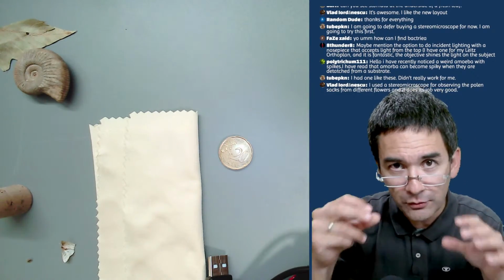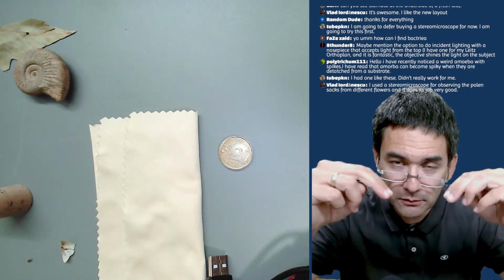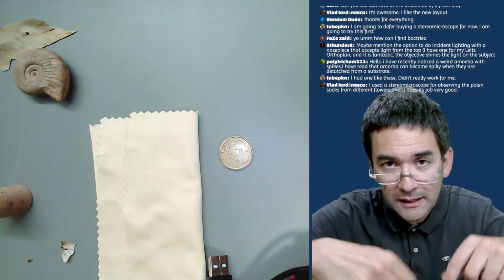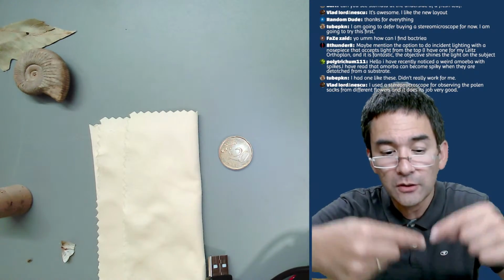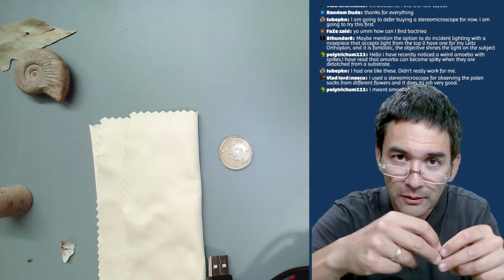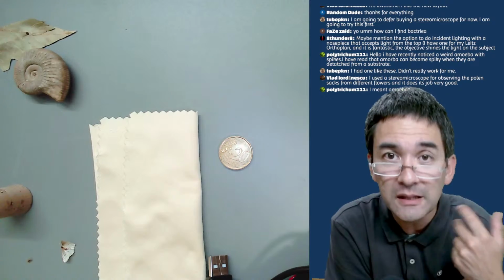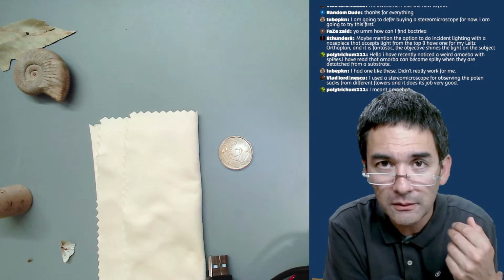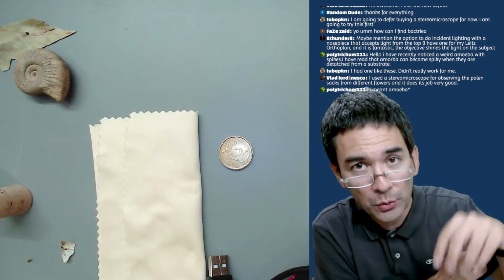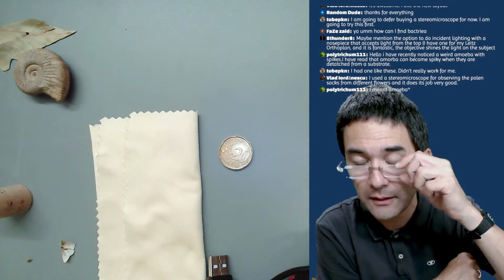What these microscopes have is objectives with a separate light path, where the light comes through the objective onto the specimen, and then the light which is reflected is picked up again by the same objective, but by a different light path, through the center of the objective. These special metallurgical microscopes allow you to look at opaque objects at high magnifications. That's also one where you have light coming from the top, but the light goes through the objective itself. Okay, thank you for the comment.